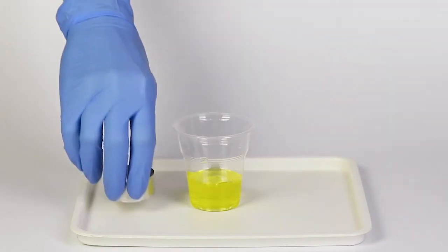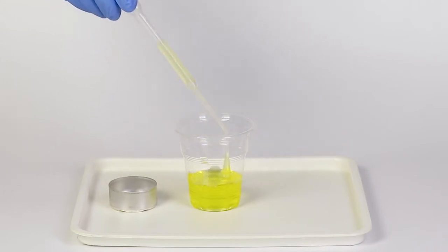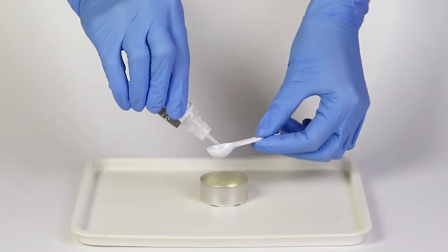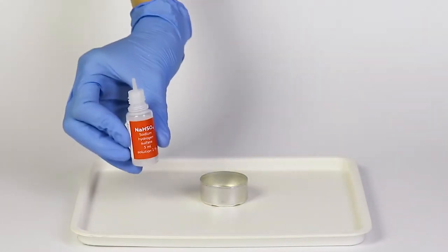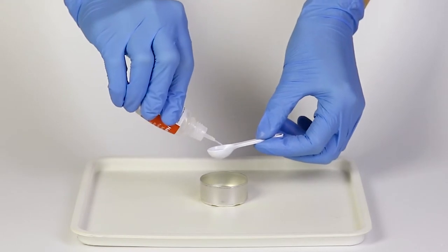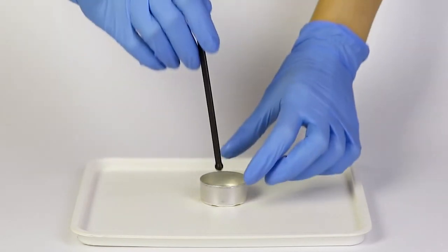Using a pipette, take approximately 1.5 to 2 milliliters of egg white and put it in the mold. Then add one spoonful of sodium hydrogen sulfate solution and one spoonful of calcium nitrate solution to the mold. Stir the mixture.